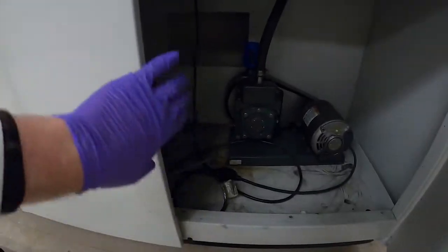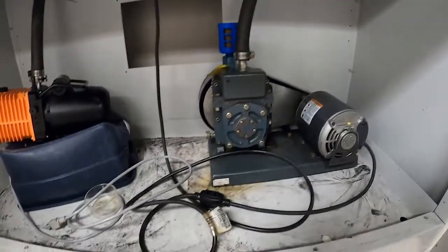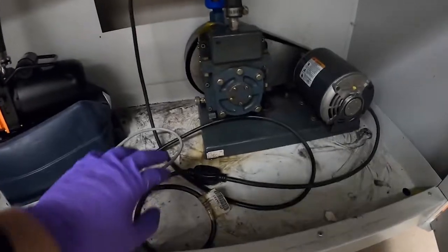The other vacuum pumps in the lab are located here. And this pump is turned on by just plugging it in up there. And this one has a switch, like its cord right here.